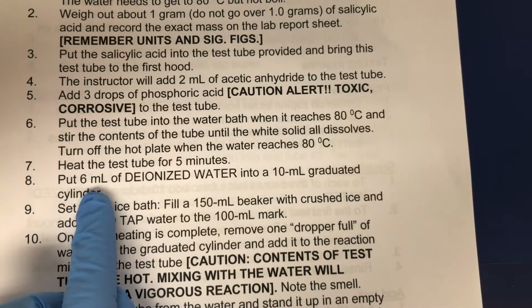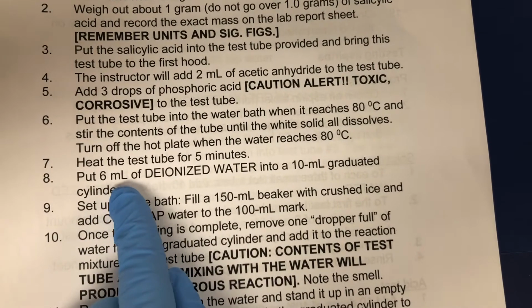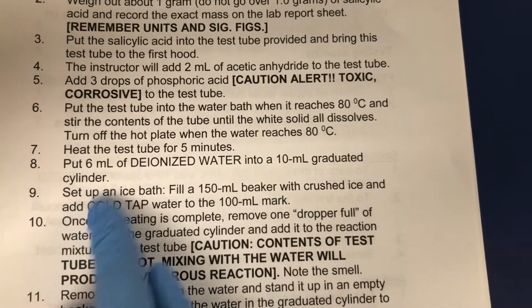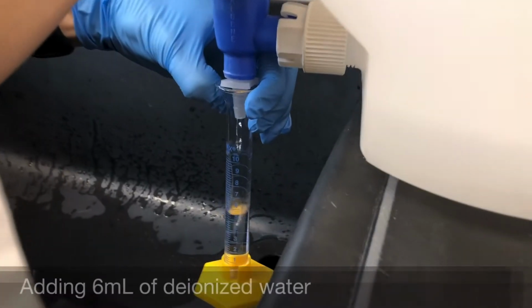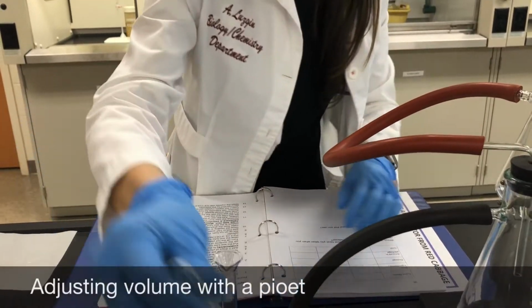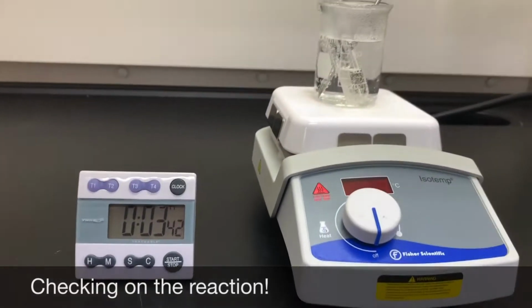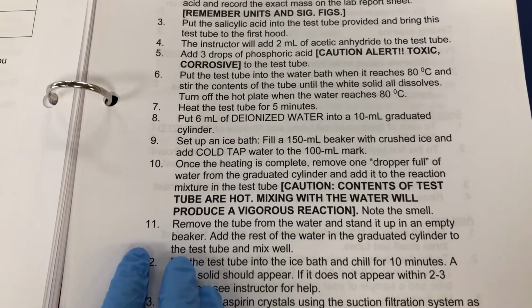Okay, so while I'm waiting for the reaction to go to completion, I'm going to do step 8. So put 6 mL of deionized water into a 10 mL graduated cylinder. So once the heating is over, I'm going to add a dropper full of water from the graduated cylinder to the reaction mixture.